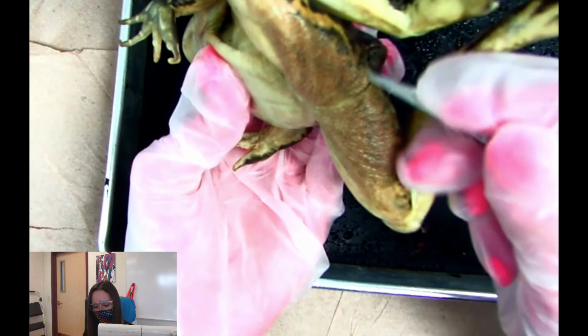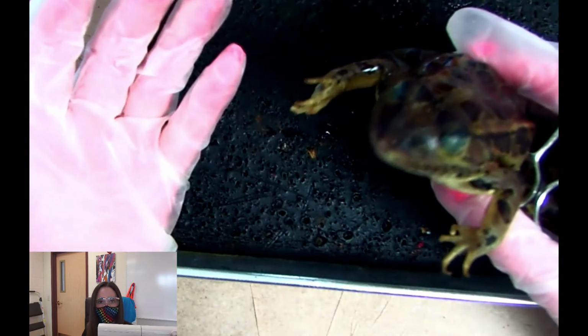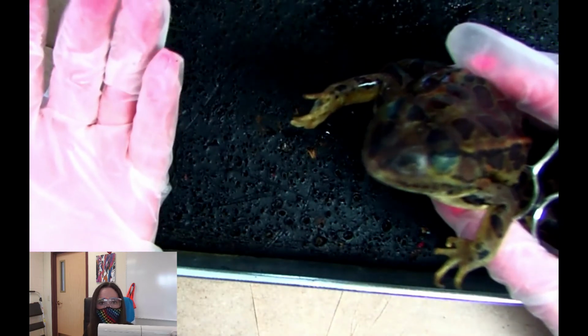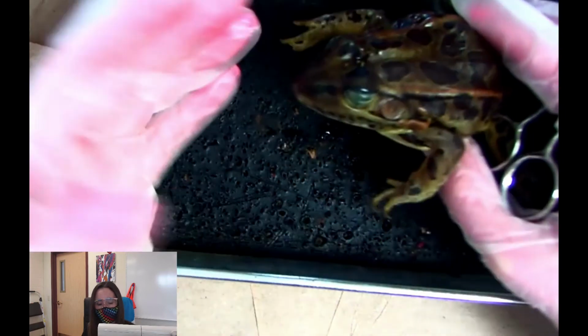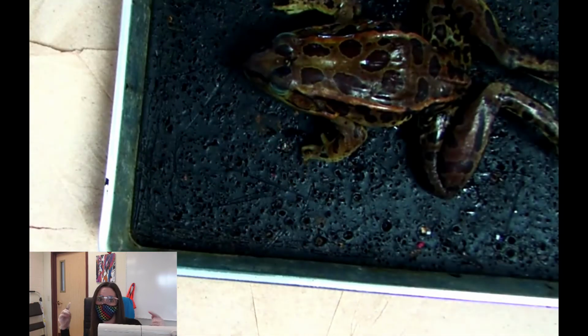So, and this part is the cloaca. So that's the cloaca. Okay. So we're actually done with the external features. Pretty easy, huh? So that'll be an easy part of the quiz, hopefully. You can always rewind this video as many times as you want to review. And let's go ahead and get to the mouth parts.